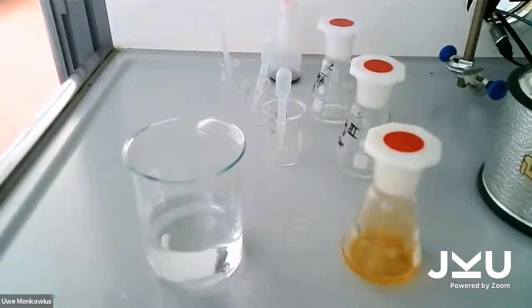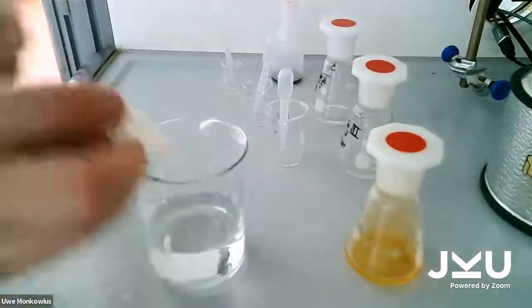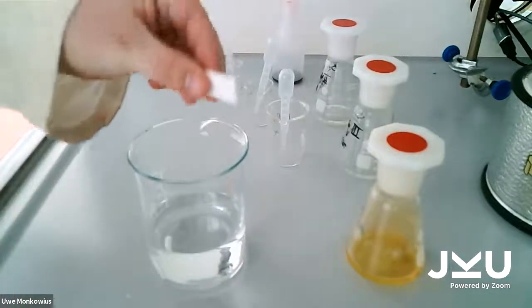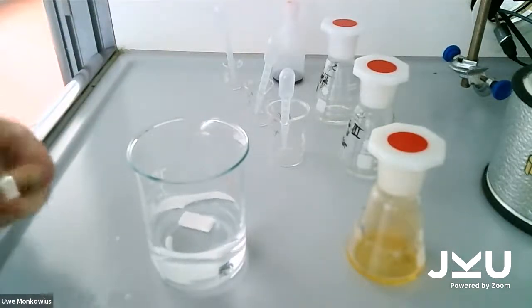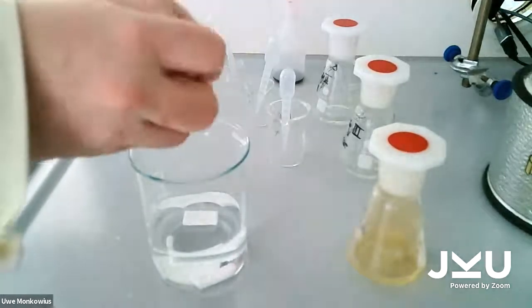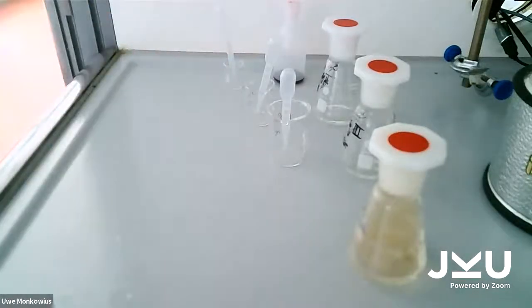And I'll add some glucose to it. So this is just some glucose that you can buy in the supermarket. I need around 8 grams. One of these weighs like 3 grams. So I'll just add 3 of those. 1, 2. And the third one. Oops. And now this has to dissolve, which will also take a while. And because this will take a while, we're going to show you another experiment that's now called elephant toothpaste.